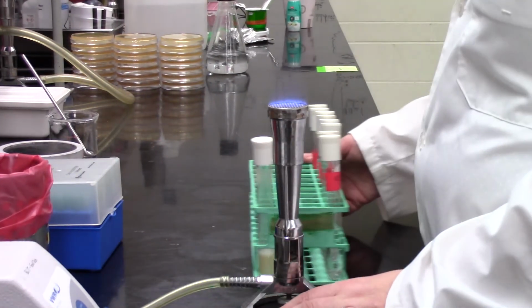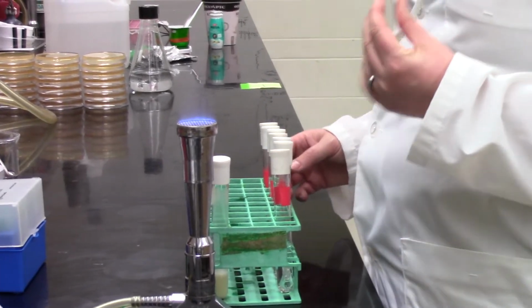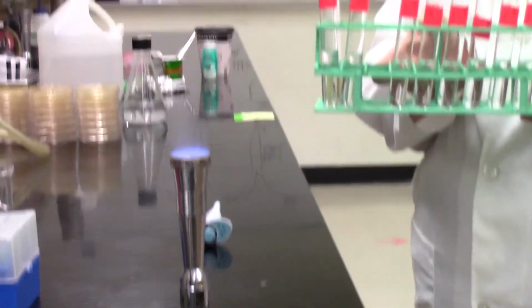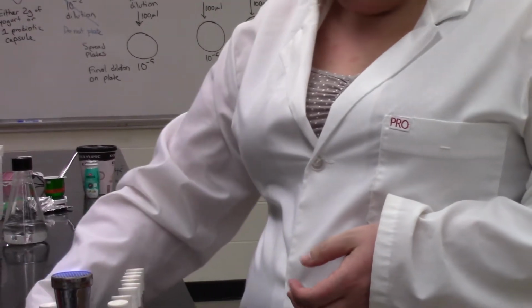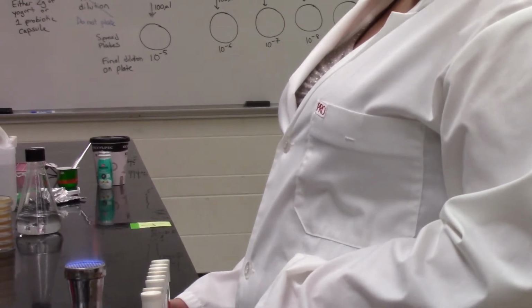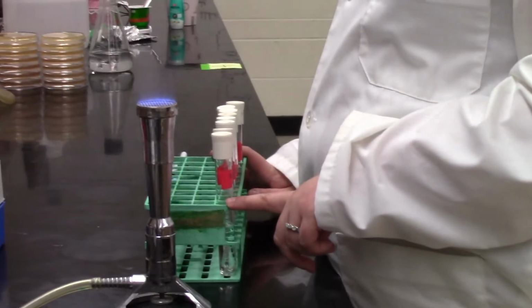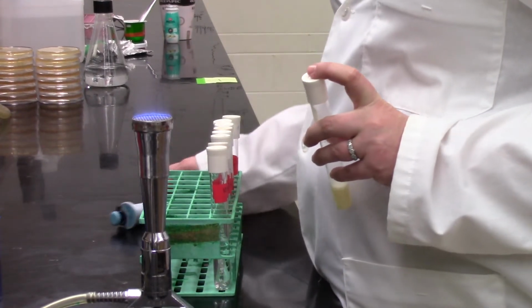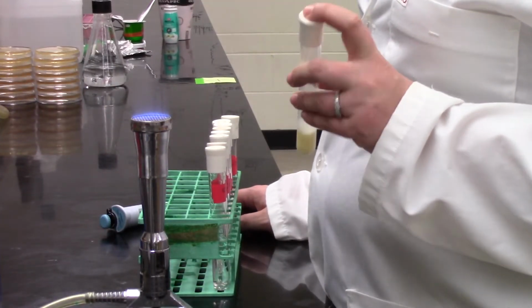So we first set up our workstation. What you can see there is that Sabrina has a lot of tubes. All those tubes with the red tape labels are the tubes that we're going to use for the dilution series. And you can see there's a lot. You can see on the board as well. We're going to be diluting this all the way down to 10 to the minus 10, because there are a lot of bacteria packed into that capsule. So we really need to make a big dilution, or we're going to have, as discussed in class, just a lawn of bacteria on the plate, right? So you can't see individual colonies and you can't enumerate them.